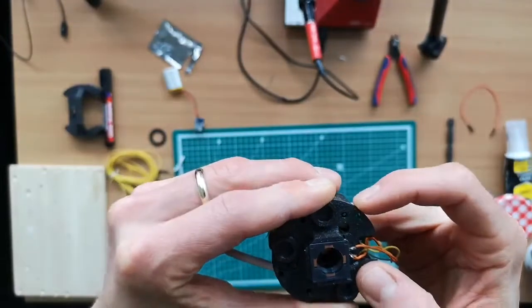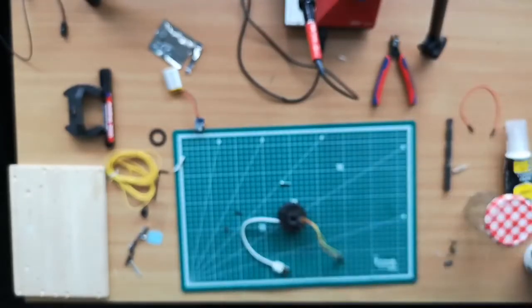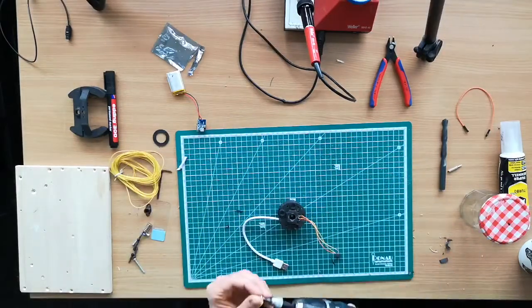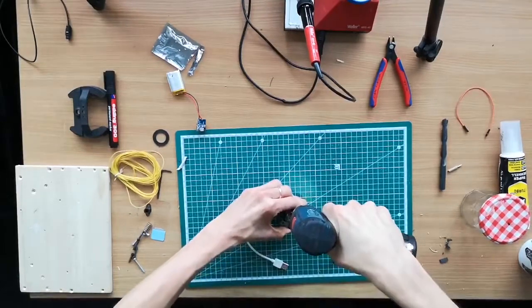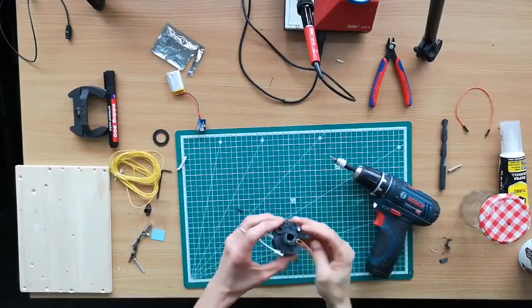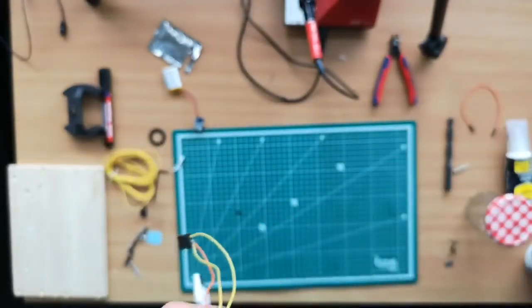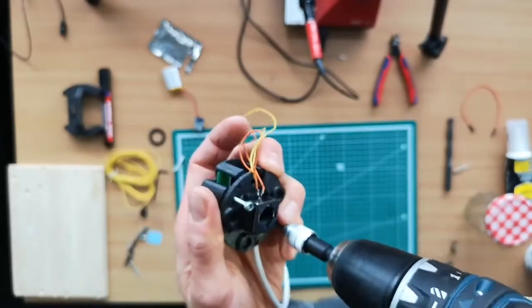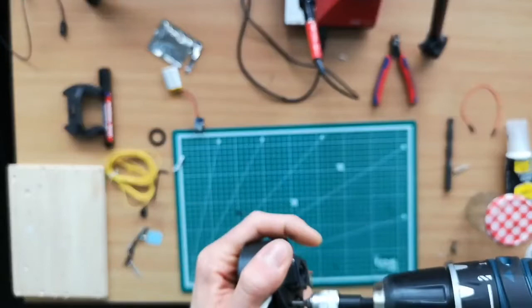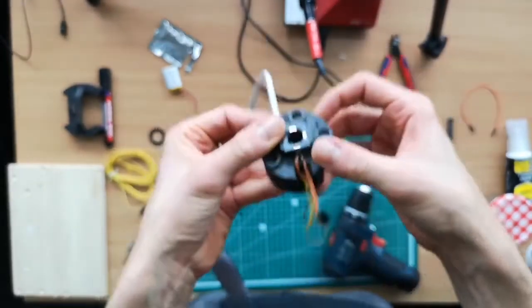And we can now close this assembly with M3 screws. So we're going to do that now with some random screws. These are M3 screws with a cylindrical head. And because I'm lazy, I'm using this battery-driven thing. Can you just use two? That's fine. And then you need to make sure that the camera is actually placed correctly inside this thing, which right now it's not, so we have to adjust it again. So that looks good. Everything's tightly put together.